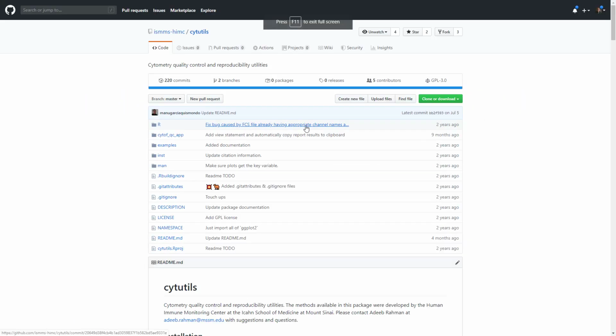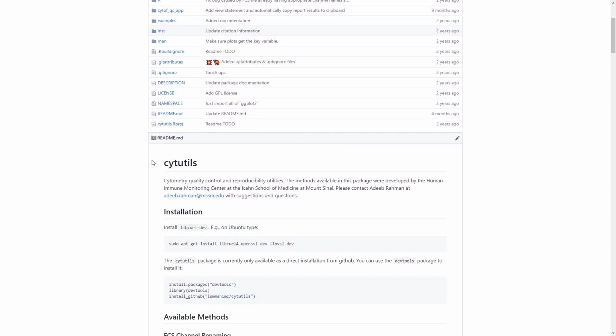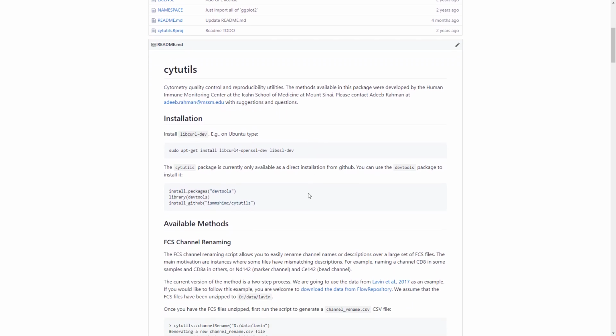package that I initially developed at Mount Sinai, and it's since been further developed by multiple people at Sinai, notably Melanie Davis, who was a computational biologist there. And cytutils has different functions to it. Here are the installation instructions, and notice that as part of installing cytutils, you will need the libcurl package. So here is how you can get it.